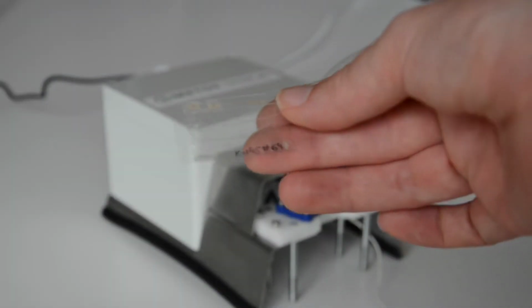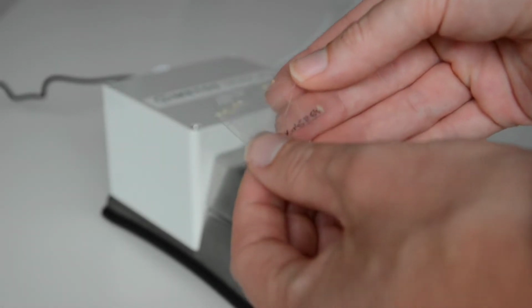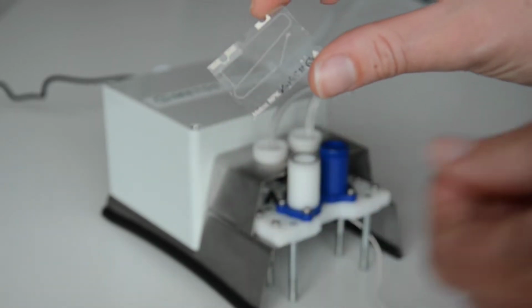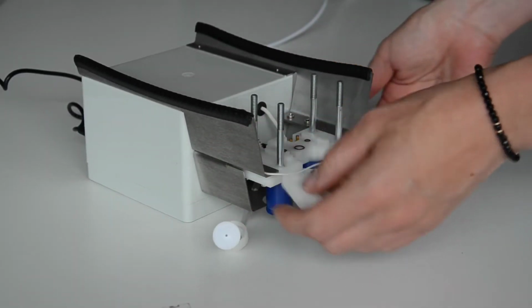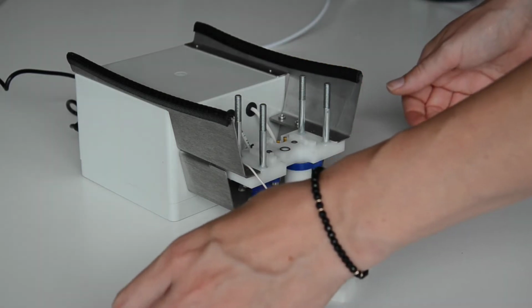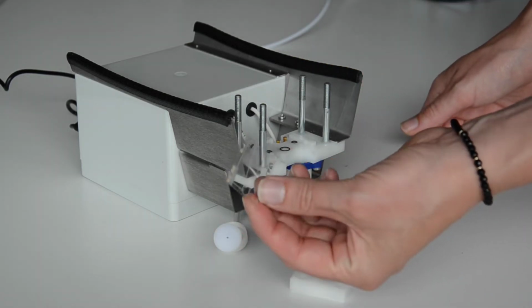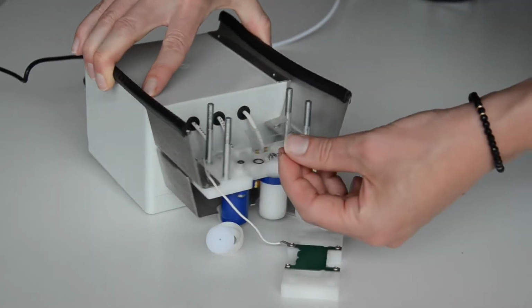Continue in our setup with the insertion of the chip. First, you need to remove the security foil and try not to bend the chip too much. To insert the chip, the device must be turned upside down. Put the chip clamp aside and insert the chip so that it fits exactly into the notches of the device.